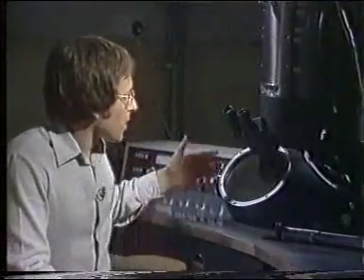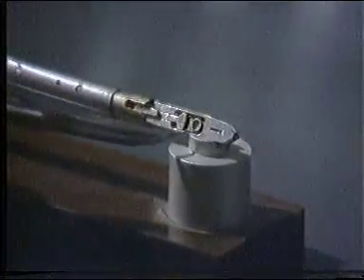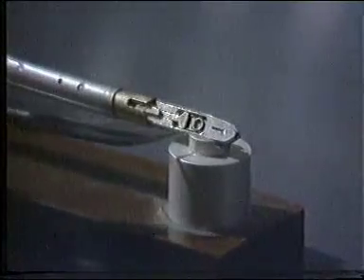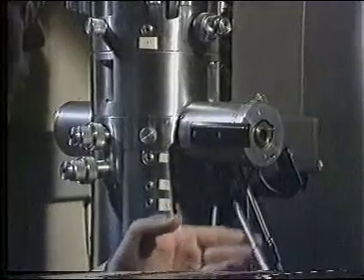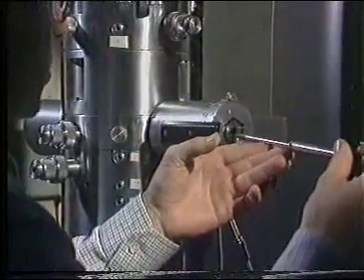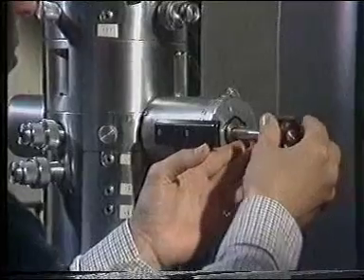But there's a problem. Electrons can't be seen by the naked eye. So in the electron microscope, we have a screen which is here, and the screen contains phosphor crystals. When electrons hit the crystals, they fluoresce and produce the image which we see. The grid has been placed on this specimen holder, and I'm now going to put it into the microscope. I can't put the specimen directly into the microscope column because you remember that is under vacuum. So first I put it into this airlock.